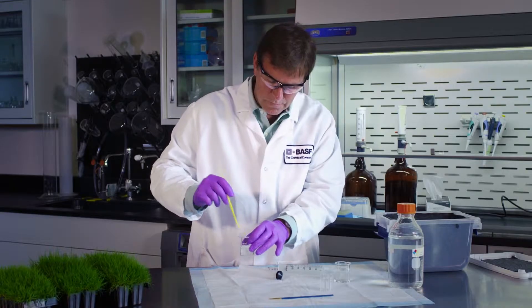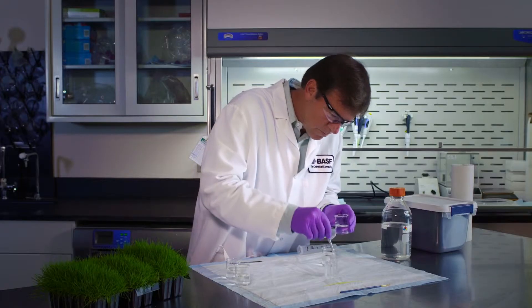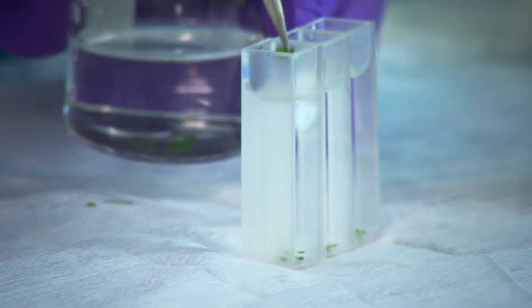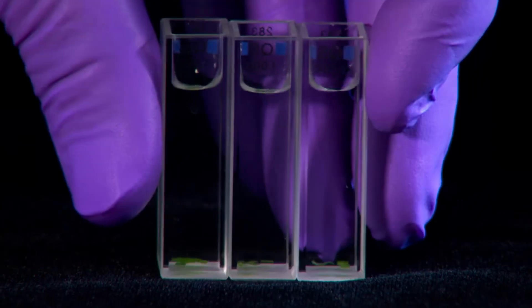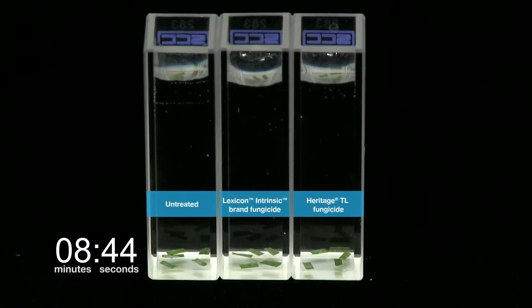After the turf segments sink to the bottom, we allow them to incubate in the dark for five minutes. At the conclusion of the five minutes, five turf segments go in each glass vial according to their treatments, and we start the timer.